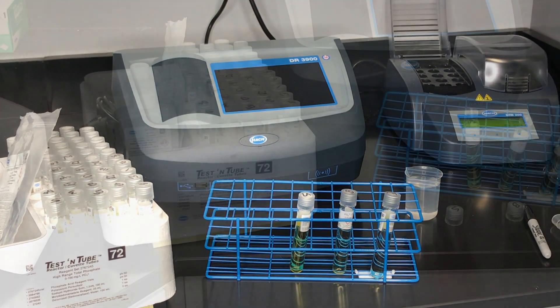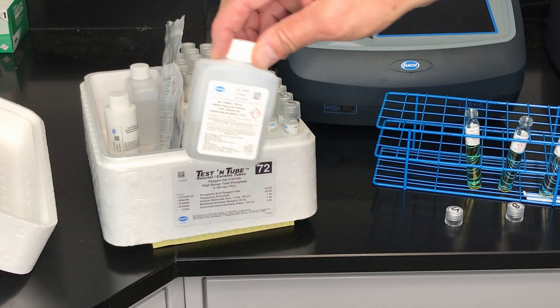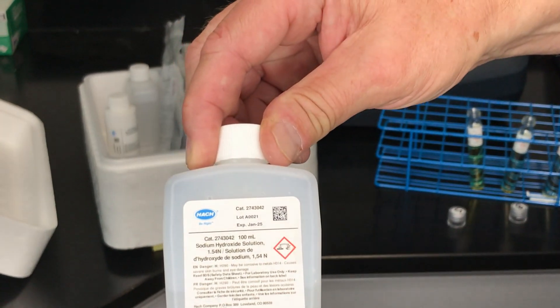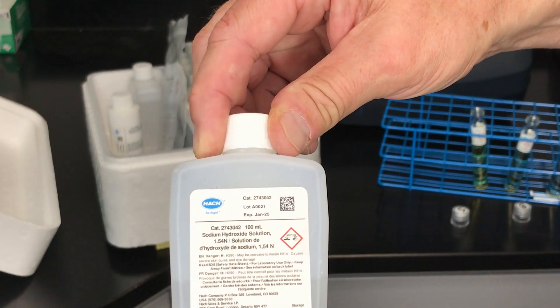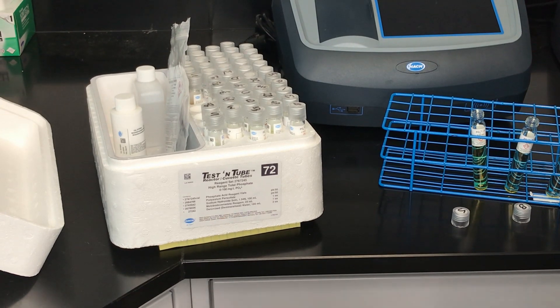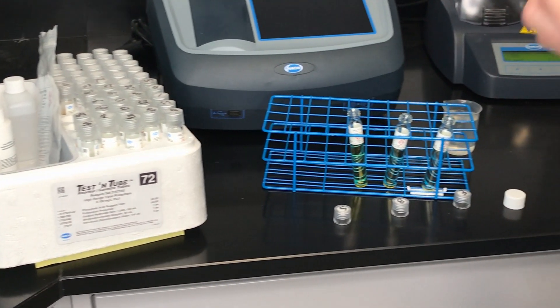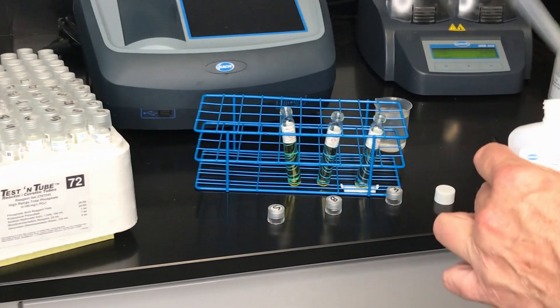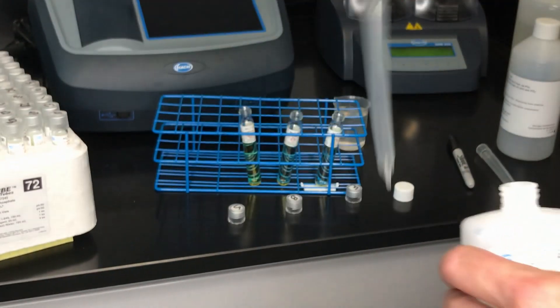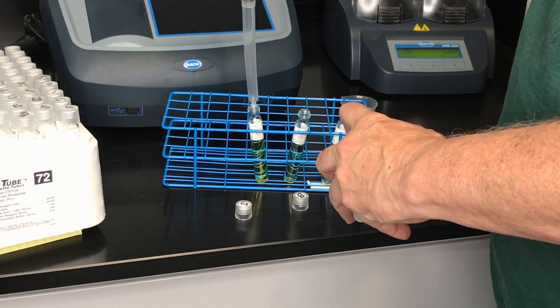Cool the vials to the touch. From the kit, remove the sodium hydroxide solution 1.54N. Using a micro pipetter, add two milliliters to each vial.